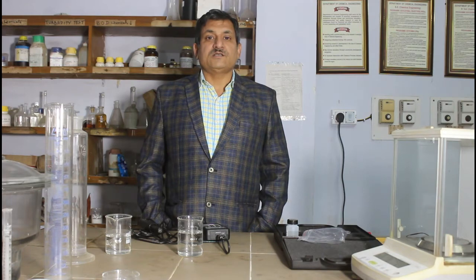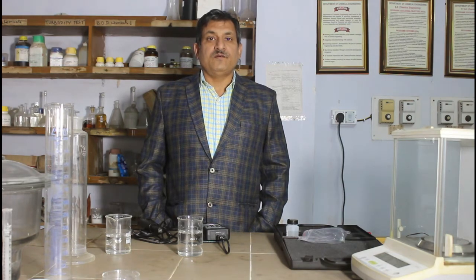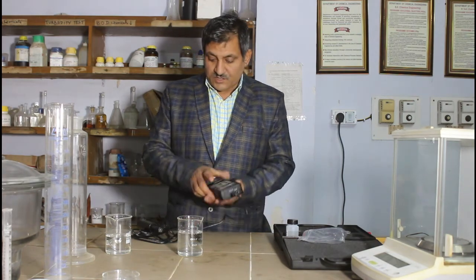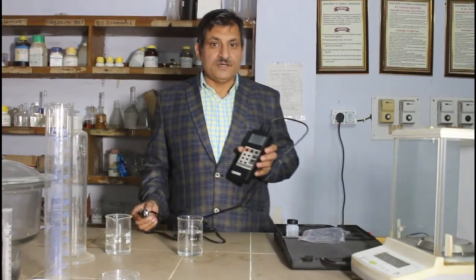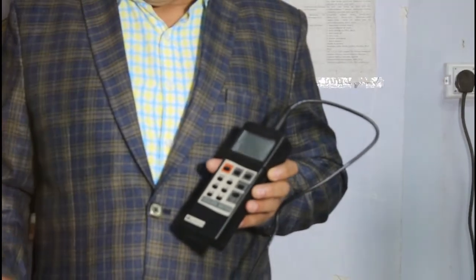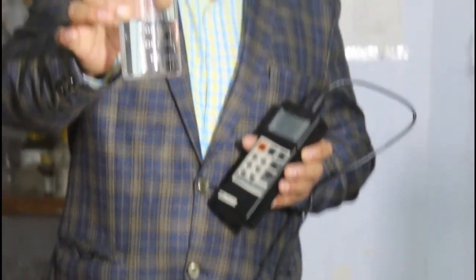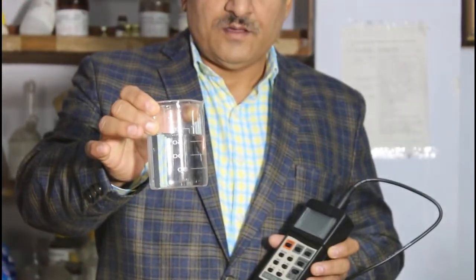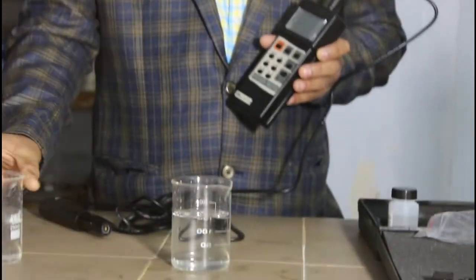Now let us perform this experiment with the help of a DO meter. This is our DO meter, that is dissolved oxygen meter. And these are the beakers — one is of tap water and another is of some effluent sample.